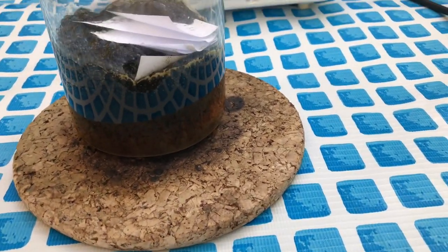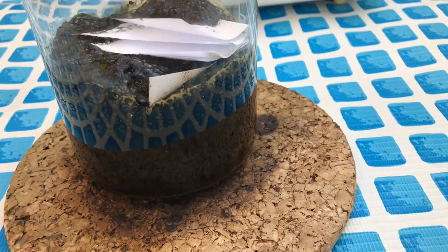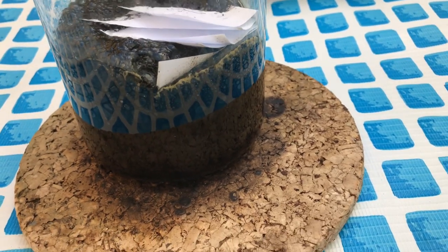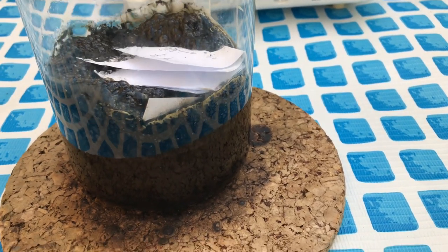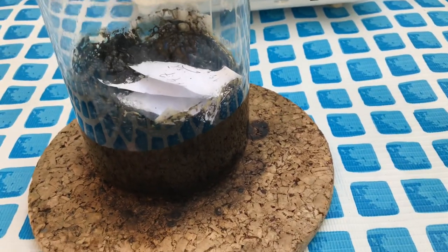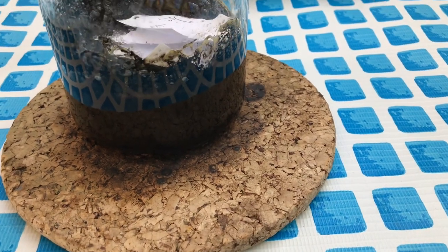It gets black first in the solution and afterwards it will turn clear. If there's not enough hydrogen peroxide left, it looks like that — and the sulfuric acid only dehydrates cellulose into carbon, water, and CO2. I was going to add some more hydrogen peroxide, but that's a bad idea to add hydrogen peroxide to hot sulfuric acid. We're not going to do that and we will simply leave the beaker like this.